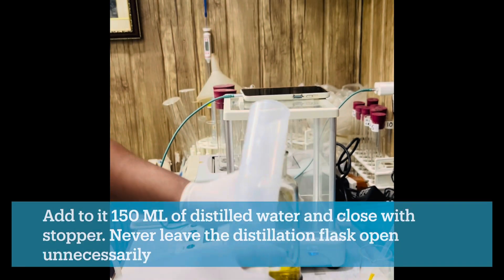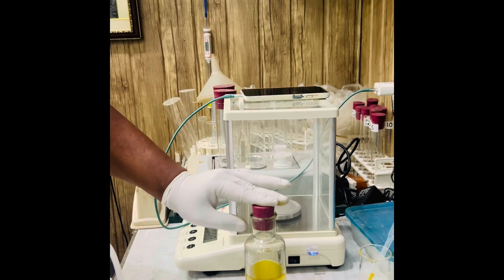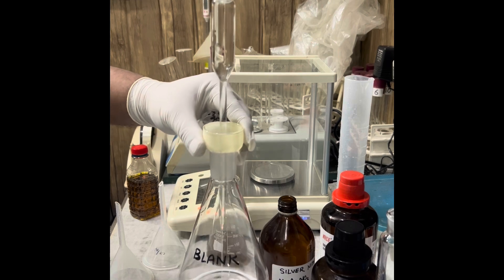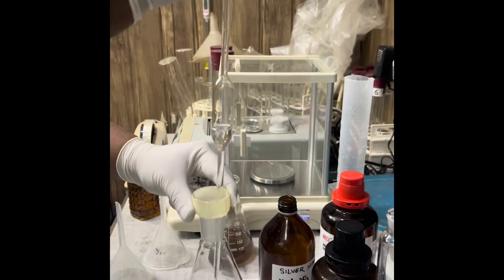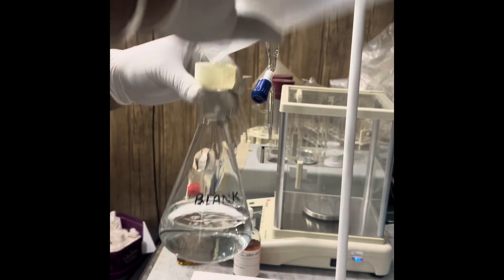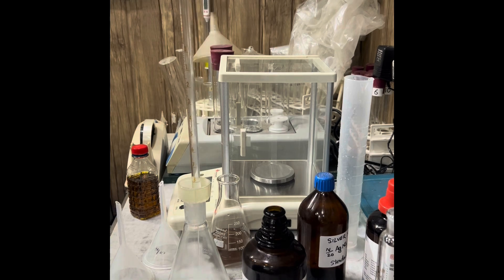In the third step, blank preparation, we will add exactly 25 ml of N/20 silver nitrate solution into an empty conical flask. Add to it 200 ml of distilled water and 5 ml of concentrated nitric acid. By this our blank sample is prepared.